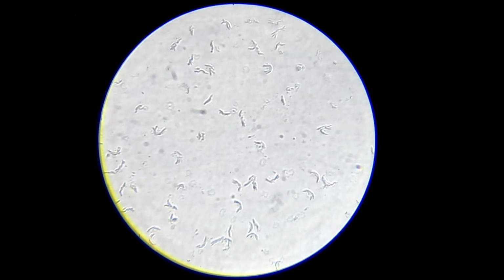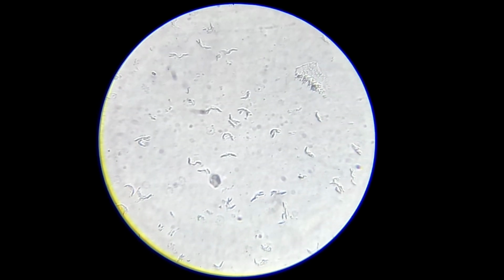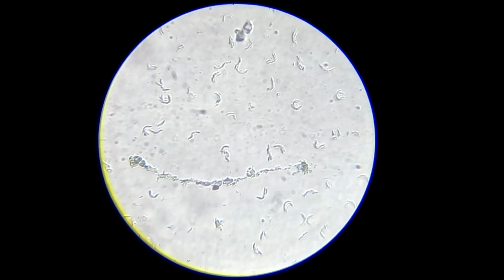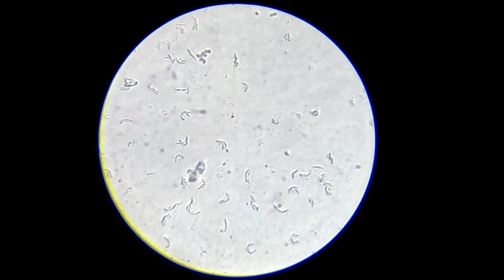This strongly suggests that these are dead bacteria or non-living bacterial remnants killed during the boiling process. Boiling destroys the internal structures required for life, but the outer cell shapes can still remain visible under higher magnification.